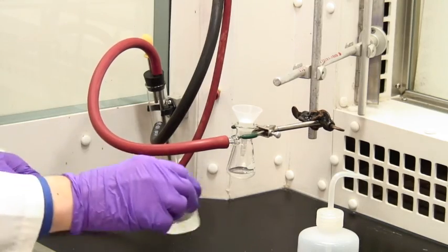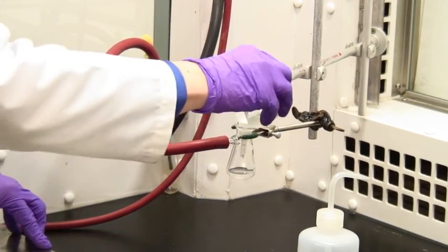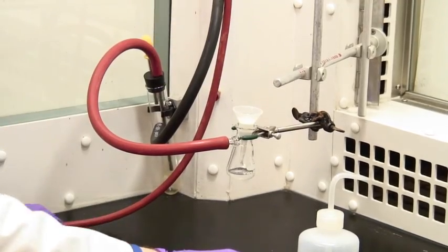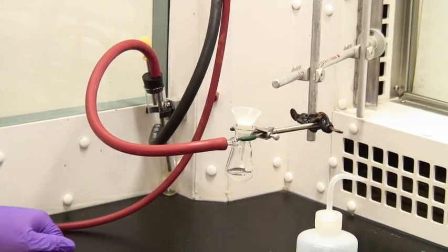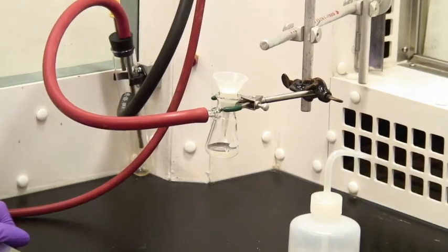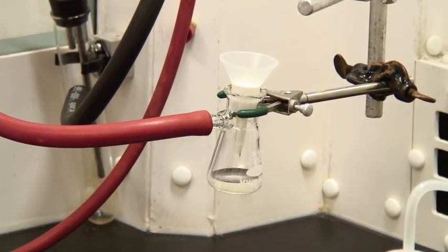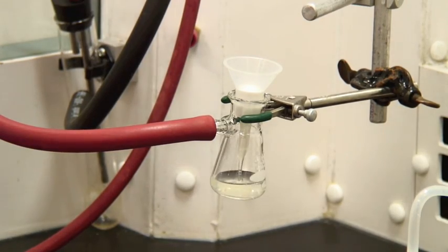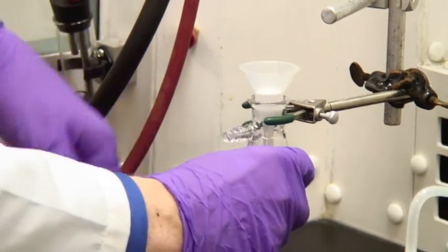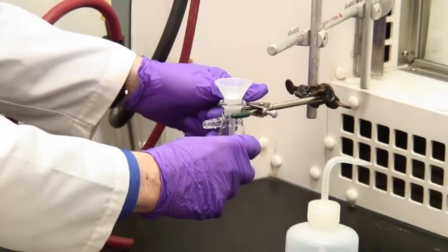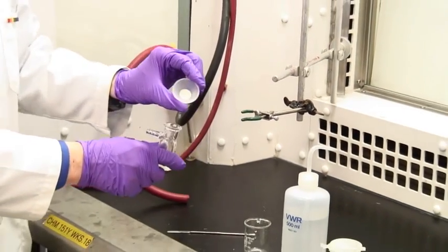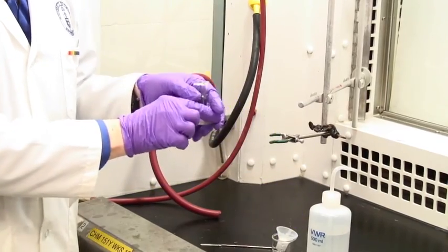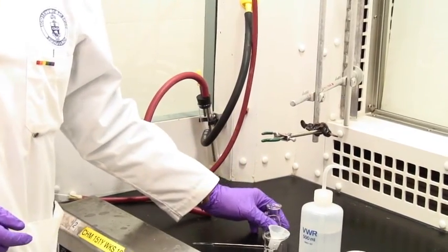Now swirl the liquid that you're interested in and pour through the filter bed. And you'll notice it's actually taking a longer time to come through. That's because the liquid is pushing through considerably finer holes. But there we are. That's all we wanted. The sludge is left up here in the filter aid, which you will then discard. And the liquid that we want is here in the Buchner flask.